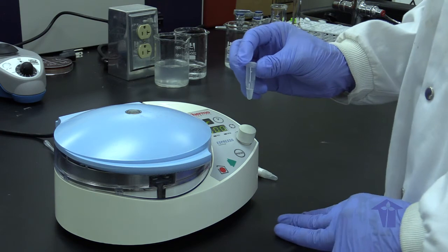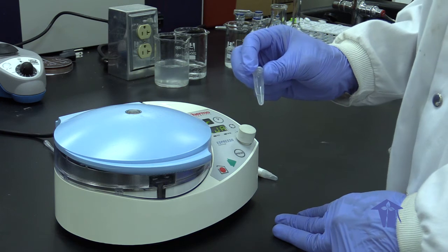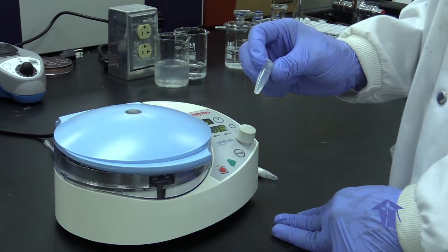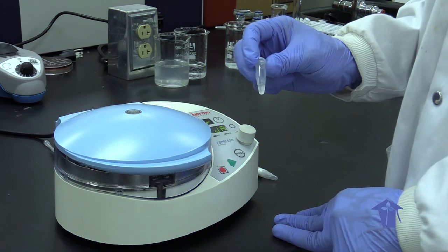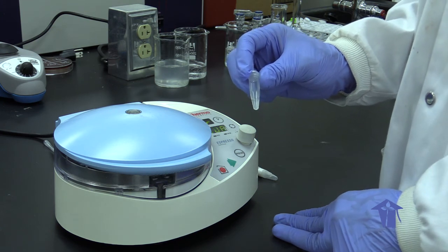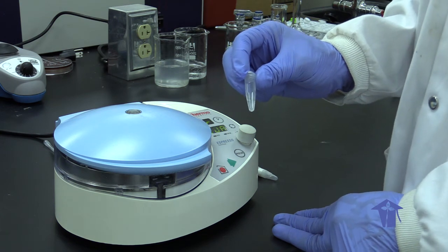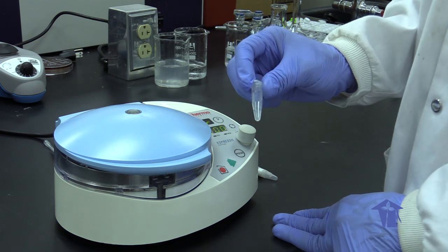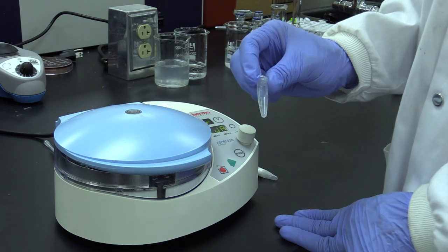After we have finished incubating our mixture with proteinase K at 65 degrees Celsius for 2 hours to be able to complete the full digestion of the cell wall and everything that is not DNA, we would then spin down our mixture with a balance in our centrifuge for 30 seconds to allow any pellet to centrifuge to the bottom. We would then remove the supernatant, which will then be used as our DNA and can be stored at minus 20 degrees Celsius for 3 months or at minus 80 degrees Celsius for up to 1 year.